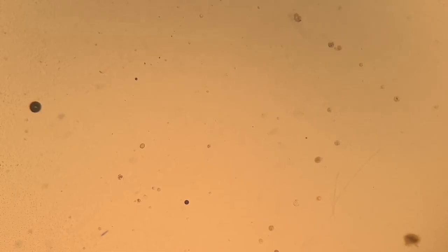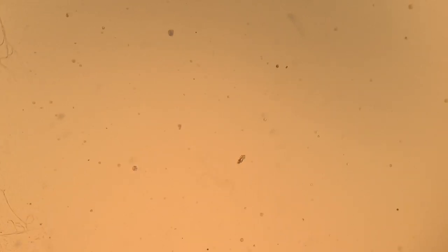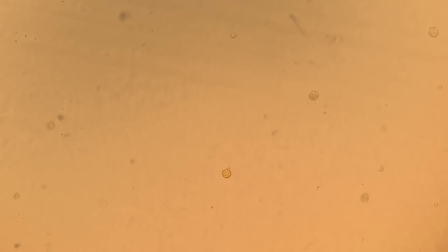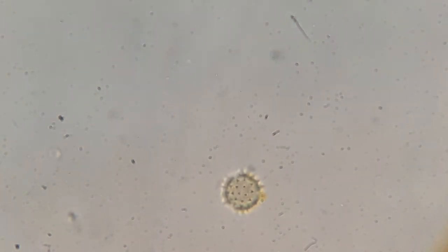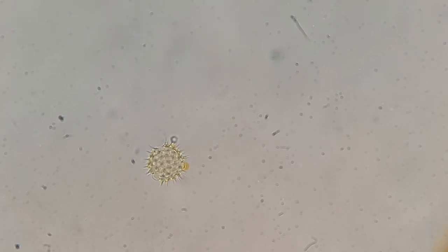Let's go ahead and take a look at the next one. So this is grade A filtered honey, and you will first notice that there is still some stuff in here. This is brand new, totally opened. The area that I was working in is pretty clean, and I still was able to see all of this in the filtered honey. However, even though there's still stuff in here, I want to remark that there is something special about this filtered honey — it isn't just passed through a special filter, but it is also pasteurized. This means that it is put under a significant amount of pressure and heat at the same time, which is usually what it takes to finally kill some of these spores. Sometimes with just heat or with just pressure, spores can survive some pretty crazy circumstances. But this honey gets both those things at the same time.